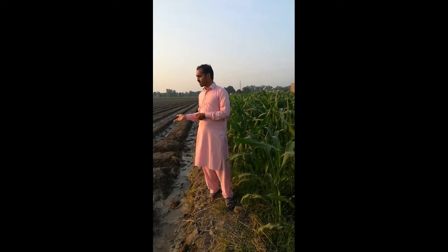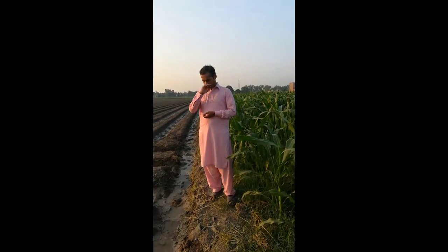Then we mix them. After mixing the 8 to 10 different samples from a unit land, we take one collective sample to analyze. Before this, we take the sample from the soil and keep it in a plastic bag, labeling the bag with the area name, date, time, and the farmer's name. Then we take it to the lab for all the other processes.